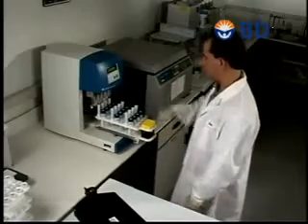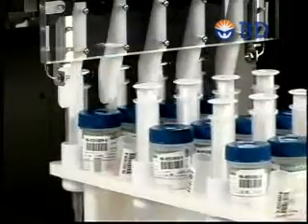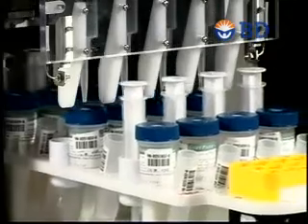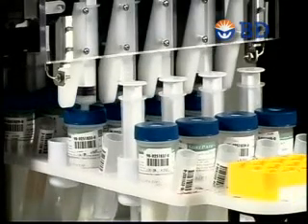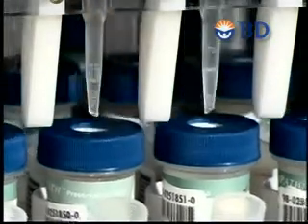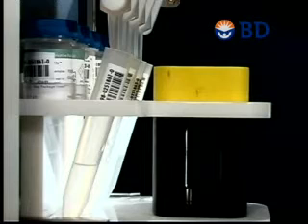The PrepMate accessory automates this phase. Once started, a disposable PrepMate syringe is loaded and pierces the cap of the SurePath sample vial, mixing the solution to randomize the cellular contents. 8 milliliters of sample solution are then withdrawn from each vial and layered onto the density reagent within the corresponding centrifuge tube. This process automatically repeats for each loaded sample.